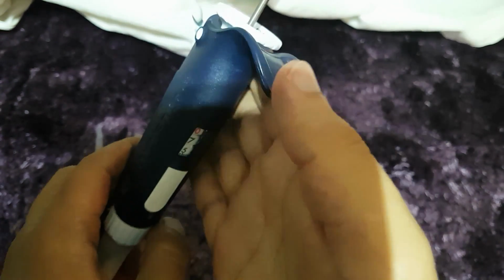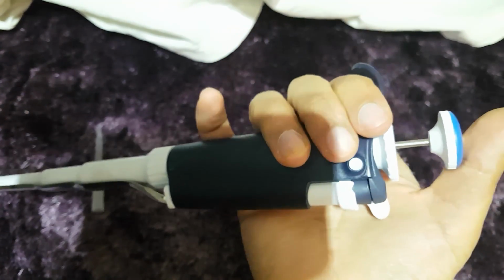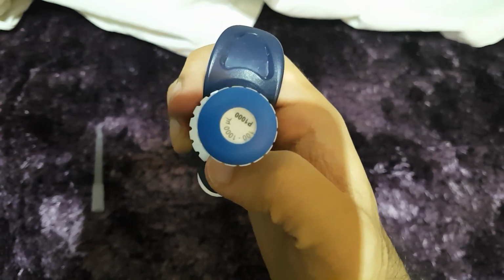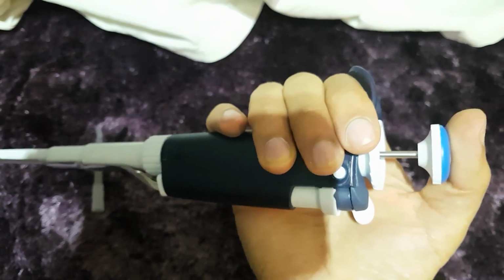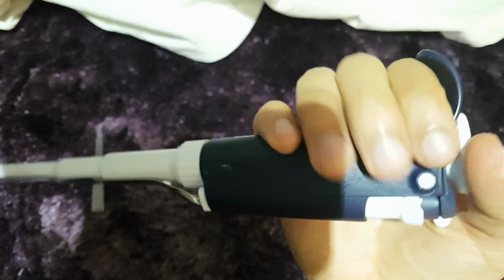Once you've selected your volume, you have to hold your pipette, depending on which hand you use. If you're right-handed, the best way to hold a pipette is like this. As you can see, I have my hand around the pipette. My finger is around here to stabilize it. My thumb is ready to push down the plunger, and my thumb is also ready to eject the tip once we're finished.